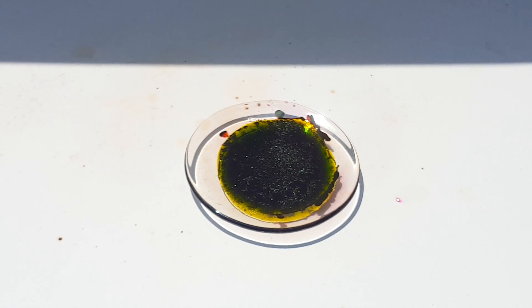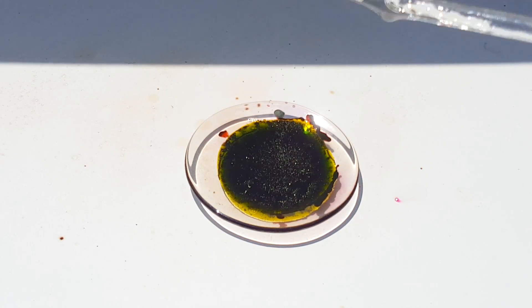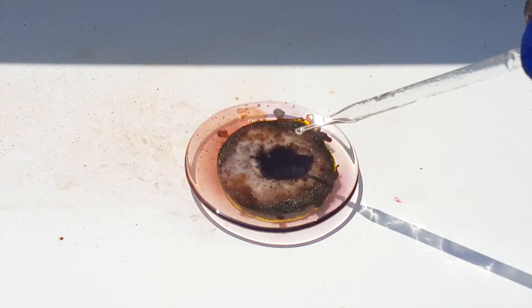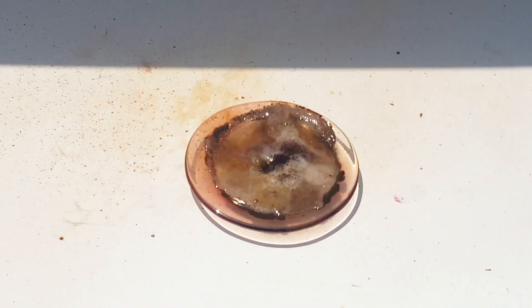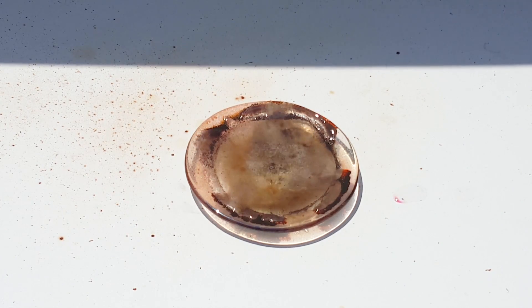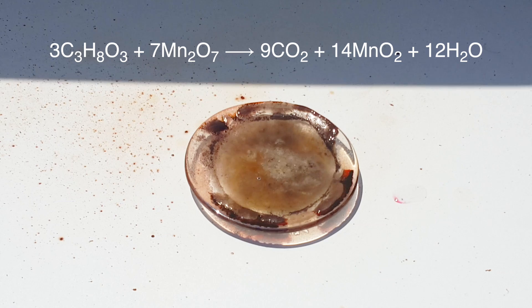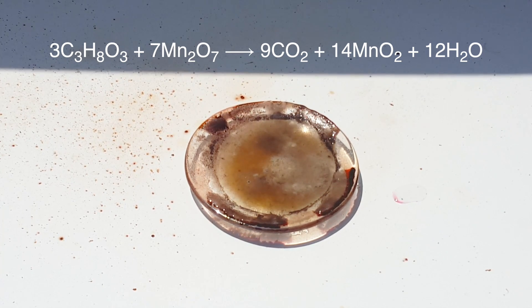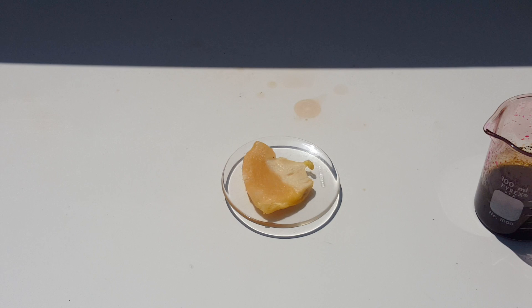To explore this a bit further, I used an older sample of glycerin for another test. The glycerin reacts far more rapidly than the olive oil, as it doesn't have the intermediate oxidation step as shown by the equation. You can see that it actually momentarily catches fire midway through the reaction.